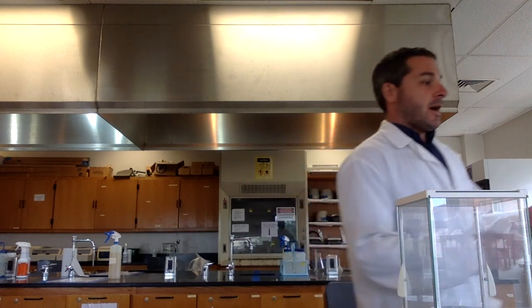For the next part of the lab, we're going to find the volume of an irregularly shaped object, if you will. So how we're going to do that is by displacement. All right, so on the procedure, you're going to go and put some water in this 100 milliliter graduated cylinder. Okay, so let me do that.